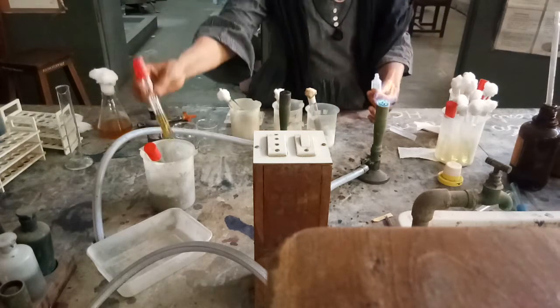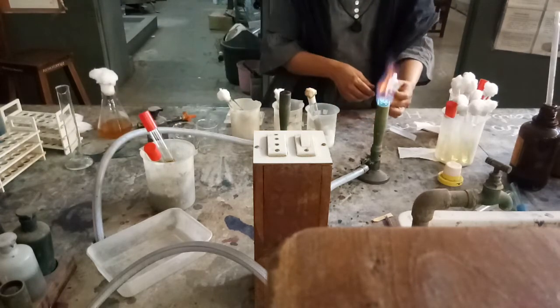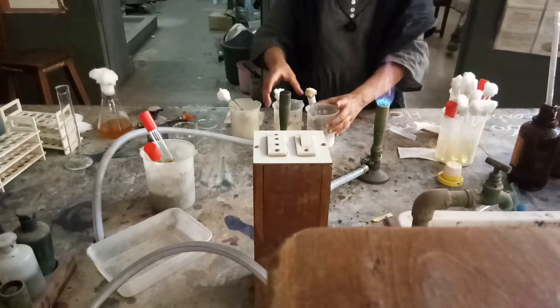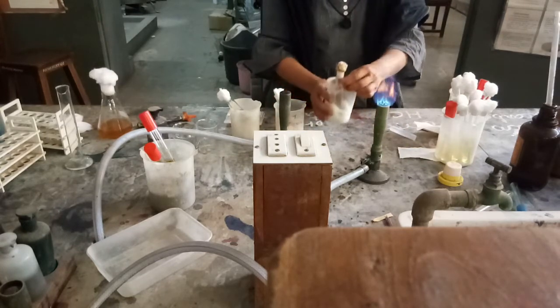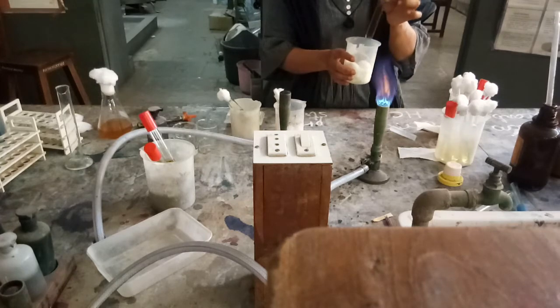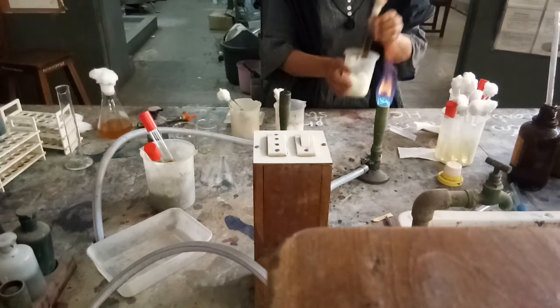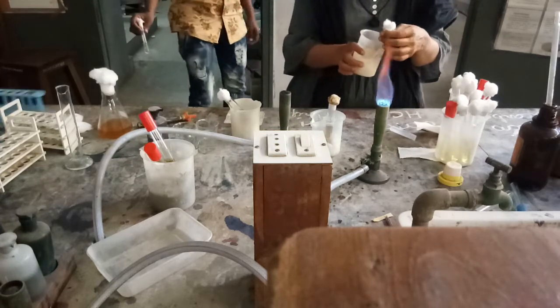Now I have three different controls with me. The very first is the control for Aspergillus — a pure culture of Aspergillus is already added in soy bean casein broth. That will be my control for the growth of fungi.